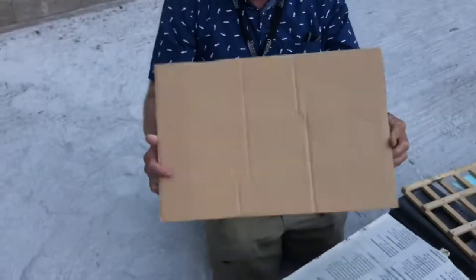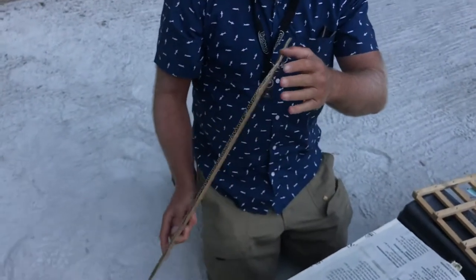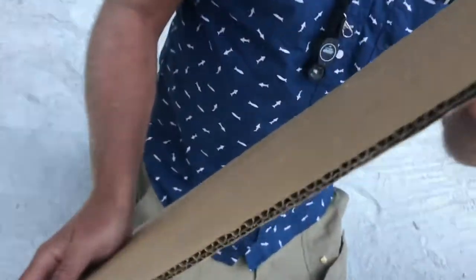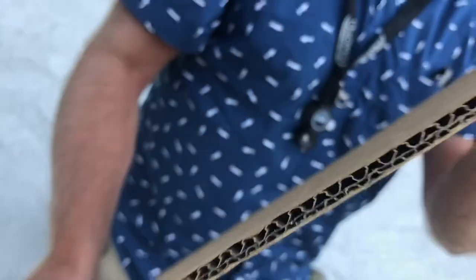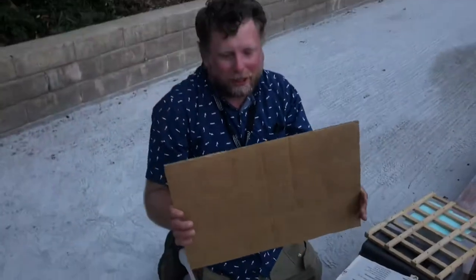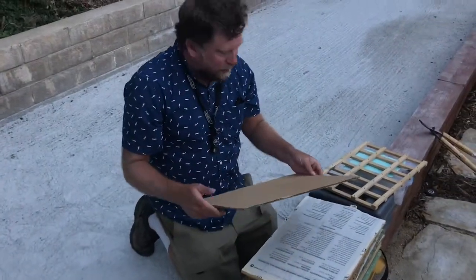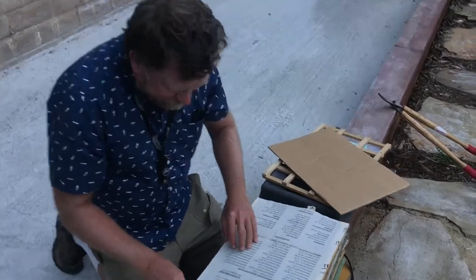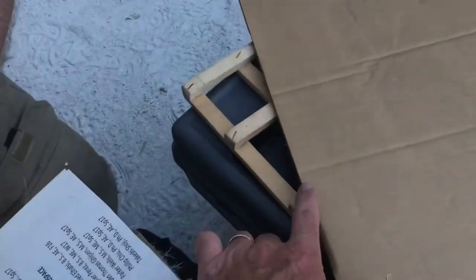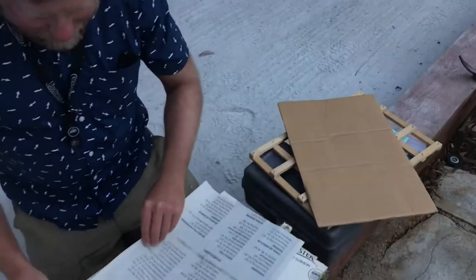They have these corrugates — basically pieces of cardboard. Sometimes tropical botanists will use aluminum, but aluminum gets really heavy. And then this is wood. So when you tighten down the strap, there's something hard that can be squeezed.